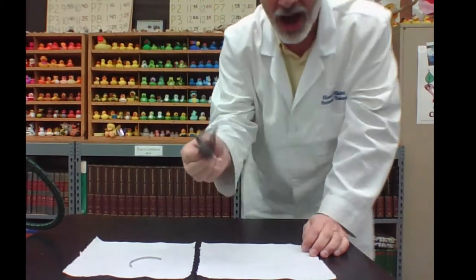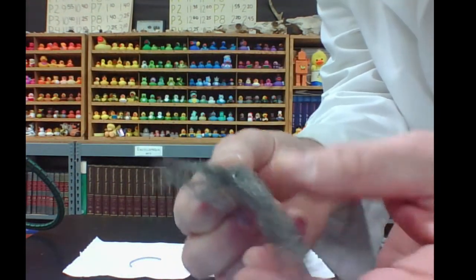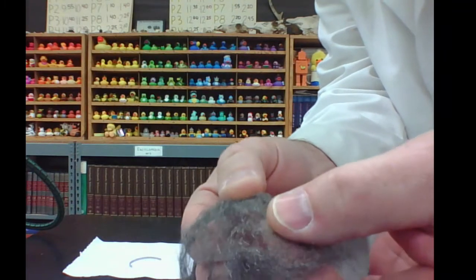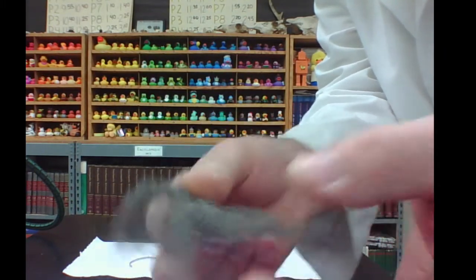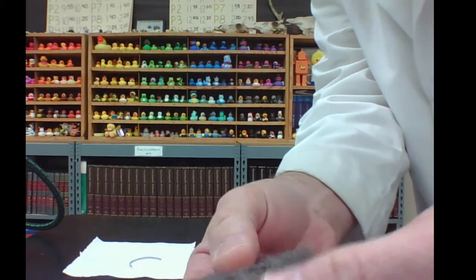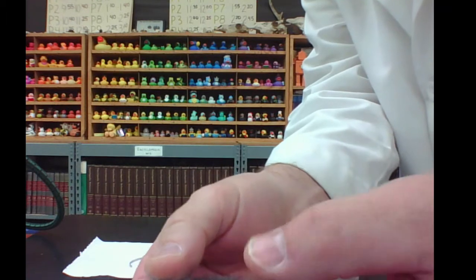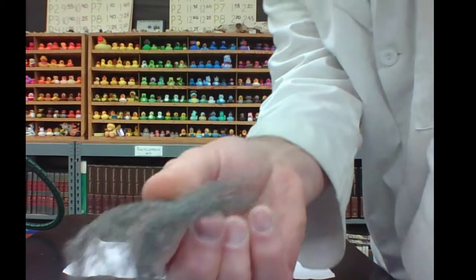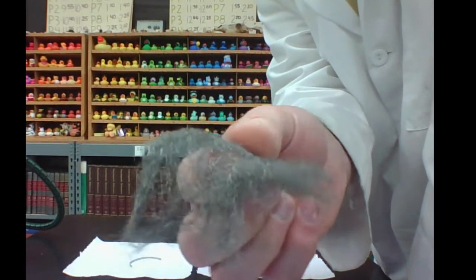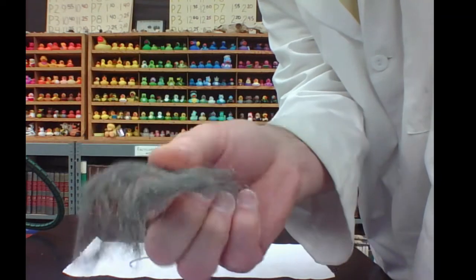So let's begin with iron. Here's the iron. You can notice its color, its ability to reflect light, its bendability. You can see its various characteristics: its color, luster, texture, and flexibility. Take a moment and record your observations now for iron.